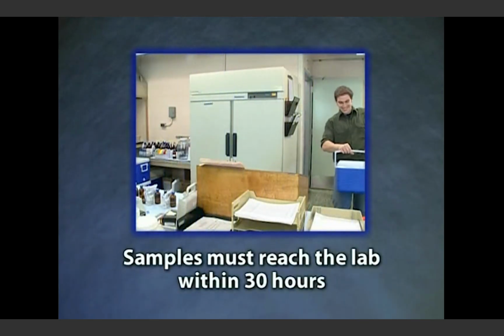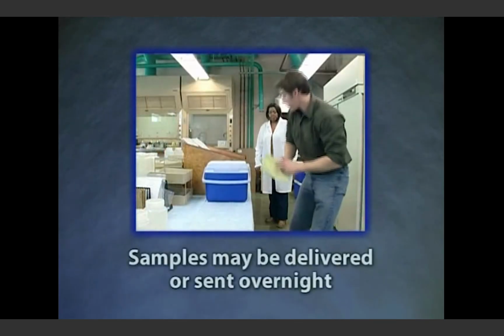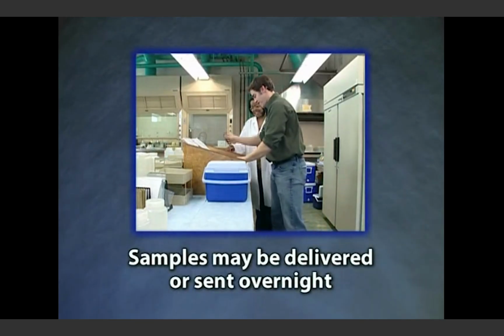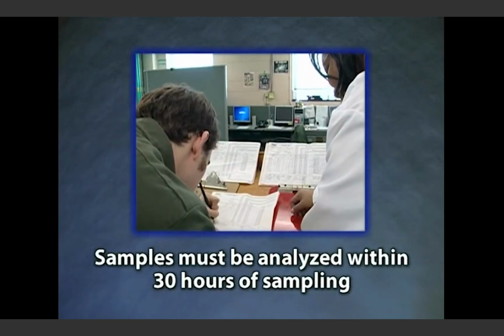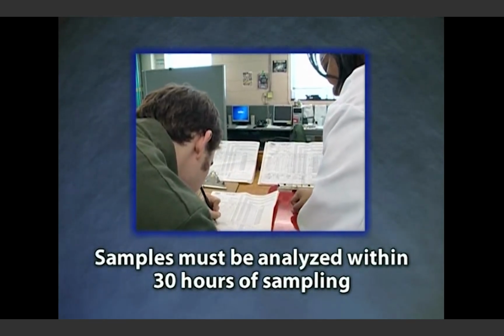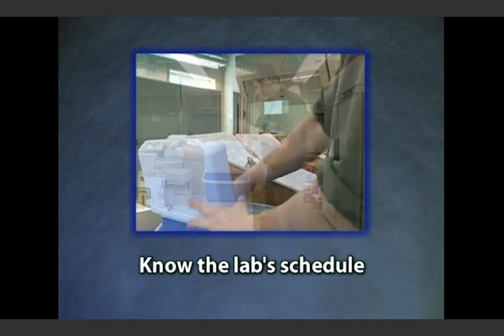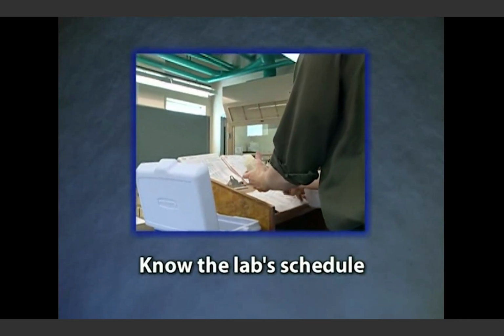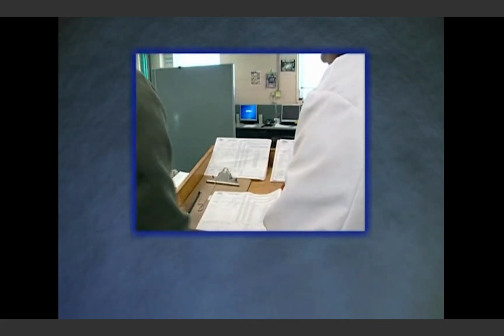Total coliform samples must reach the testing laboratory within 30 hours. Samples may be delivered to the lab or sent via overnight delivery. The samples must be analyzed within 30 hours of the sampling, regardless of when they are delivered. Any sample not processed within the required time frame will be rejected, so know the lab's schedule and whether they are closed on weekends and/or holidays.